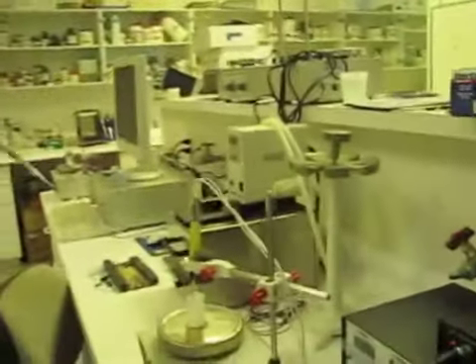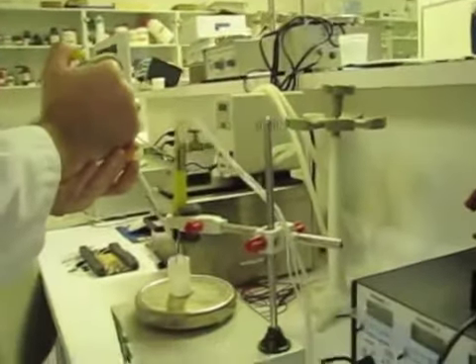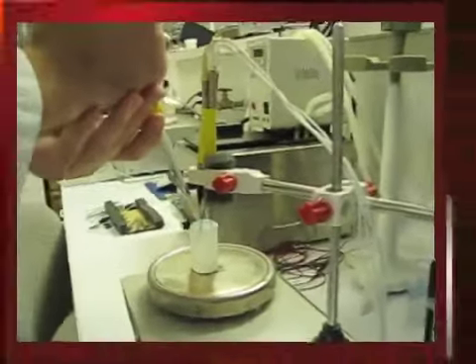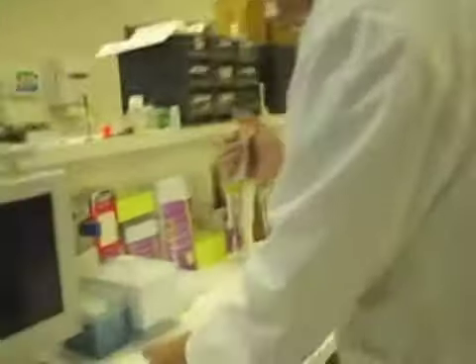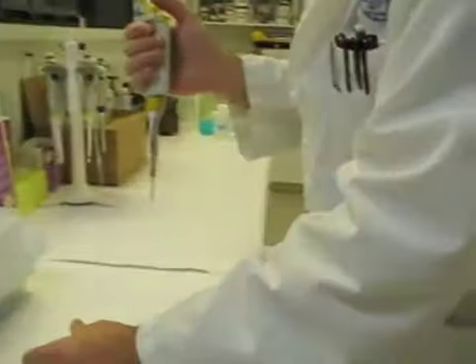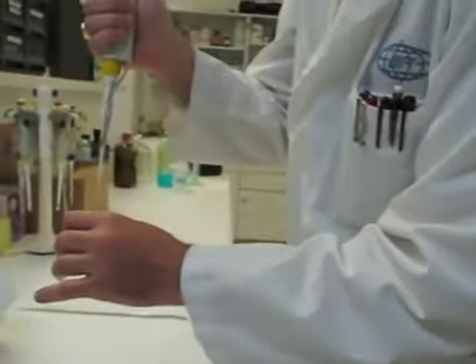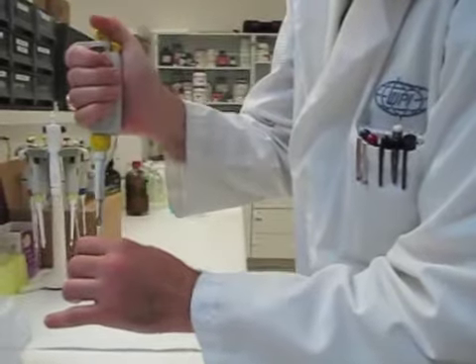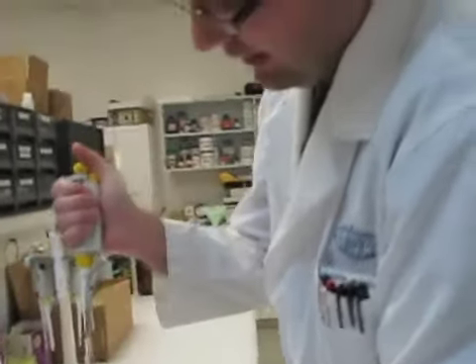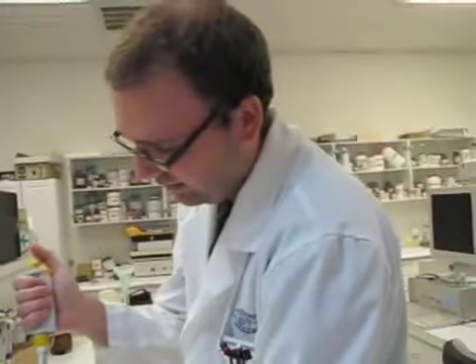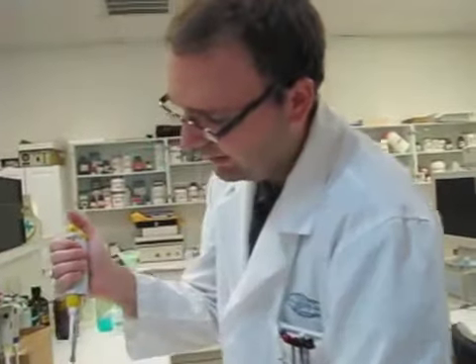Again, try to make the same general spot location for my injection. We will double again to 8 microliters. This will result in a final concentration of 400 nanomolar right now.